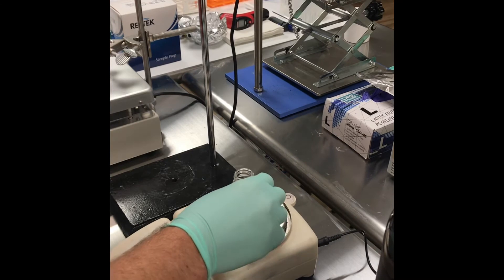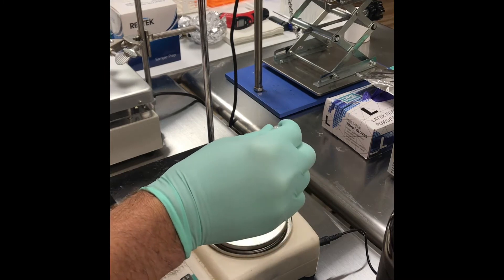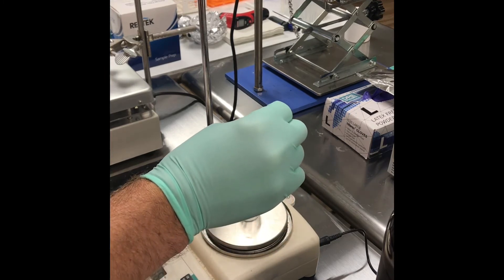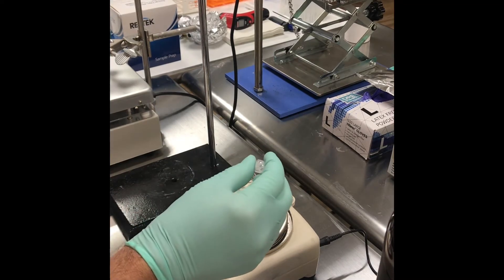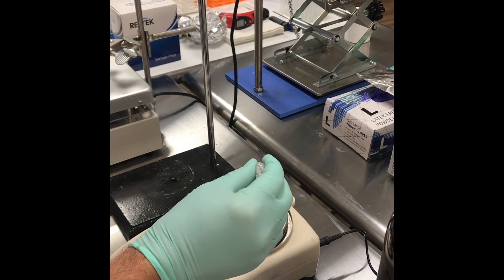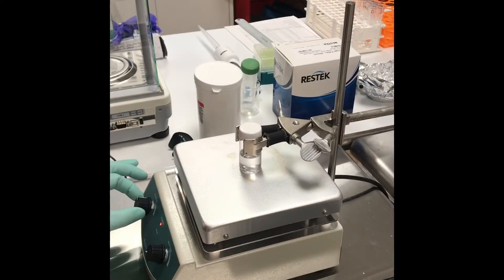For this experiment I'm going to make 15 grams total. The recipe calls for 8.6 grams of the solvent. Next I'm adding 0.3 grams of the Paraloid polymer, and we need to mix this to get all that polymer into solution.